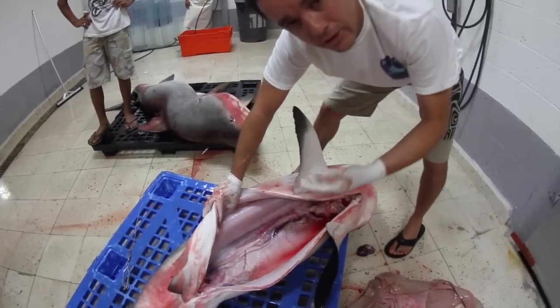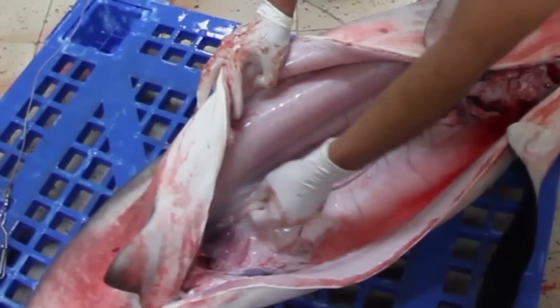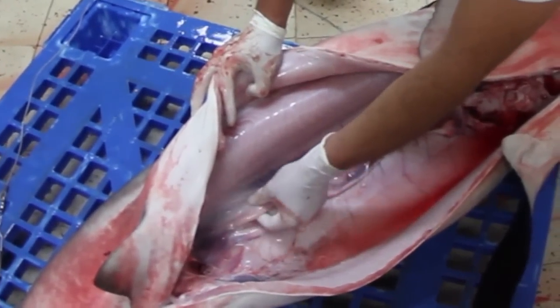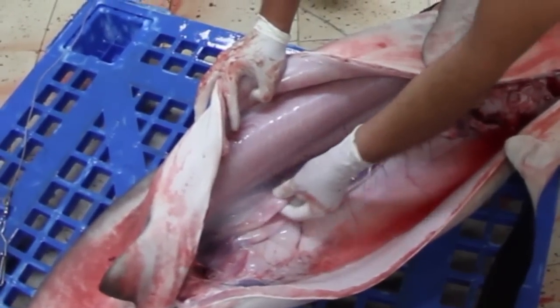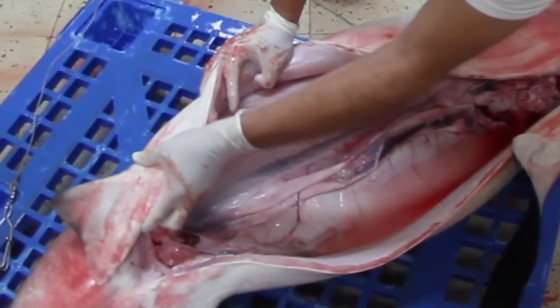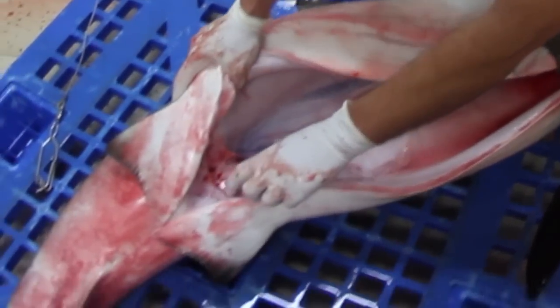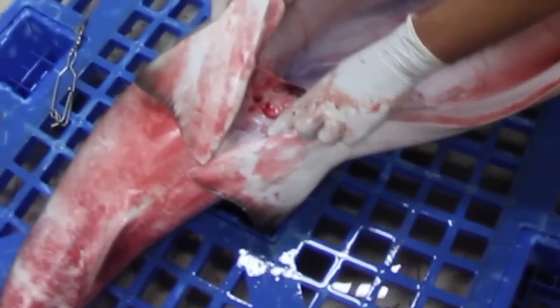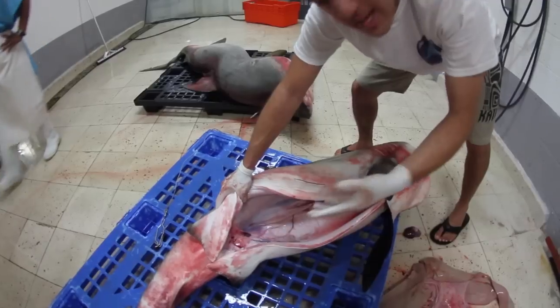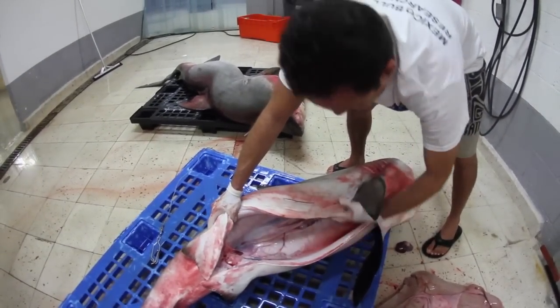This is a female that has not yet had pups — the uterus is quite small. Here begins the gestation period, which can last several months, and after birth the young pass through the cloaca. These are the urinary papillae, connected directly to the kidneys, from where the urine of the animal comes.